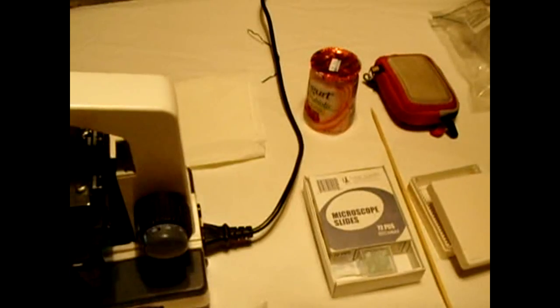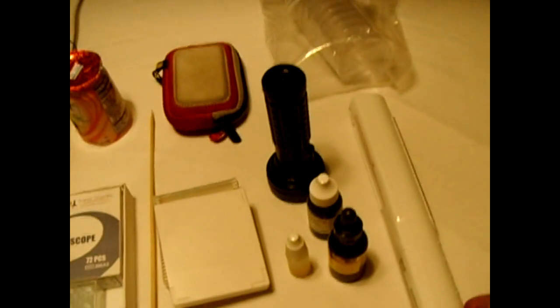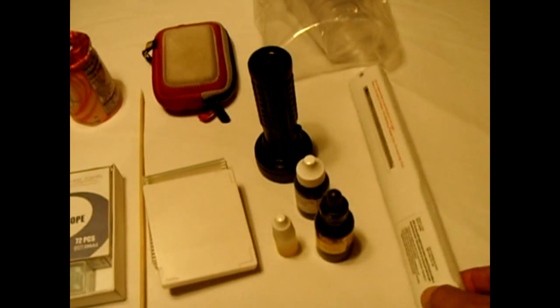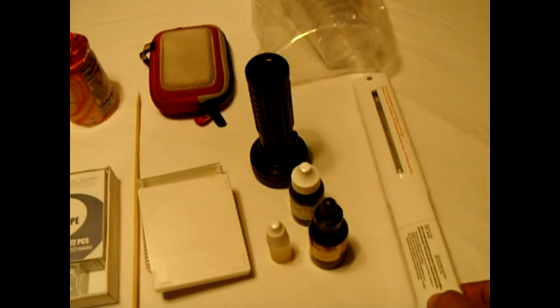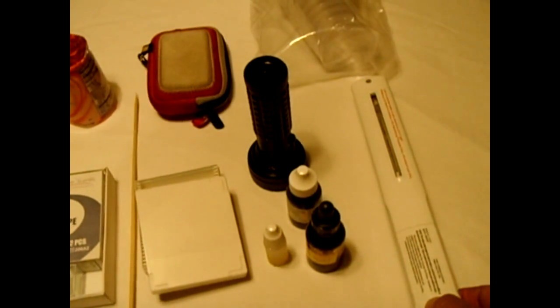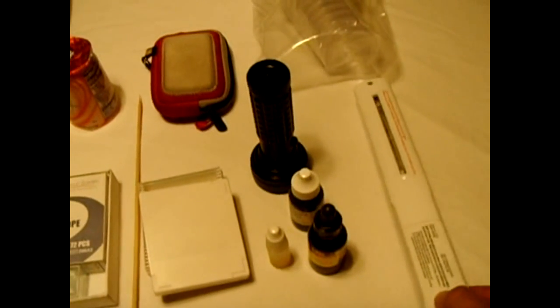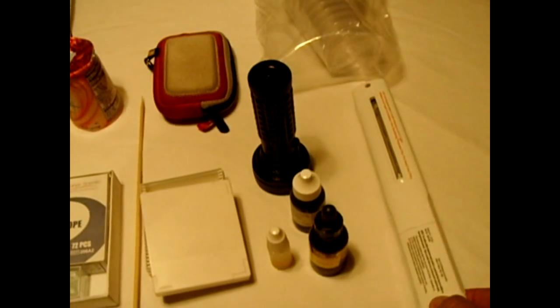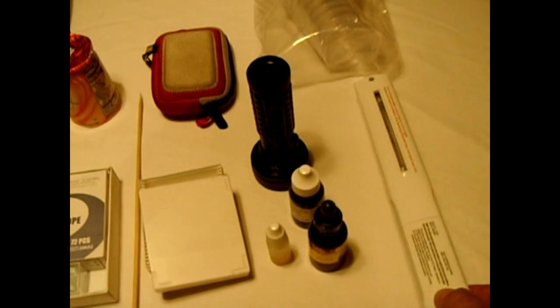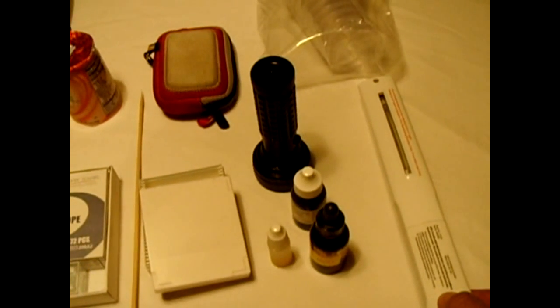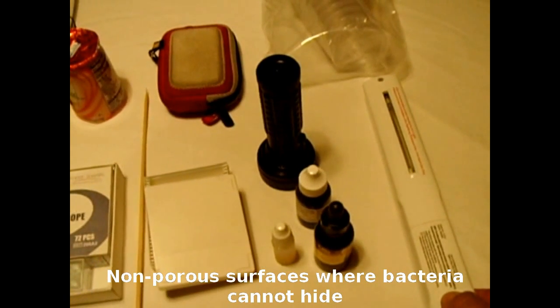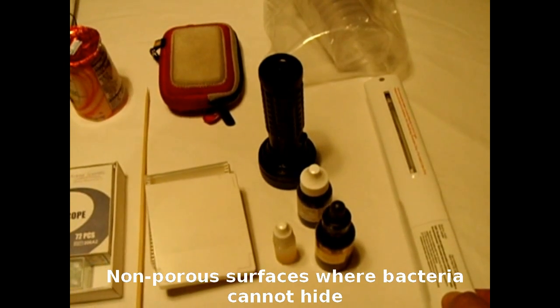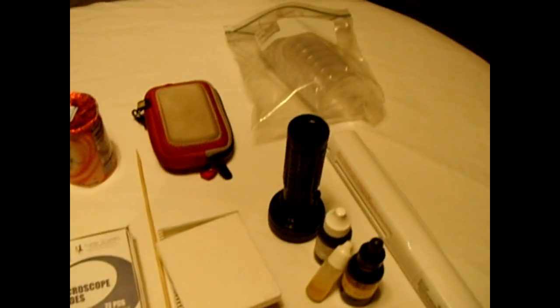We'll see what kind of an effect ultraviolet light has on that bacteria. Now this one here is ultraviolet light UVC. It has a short wavelength and it's a germicidal wand. Its intended use is to sterilize countertops and other hard surfaces and to kill bacteria and viruses. They claim up to 99.9 percent.